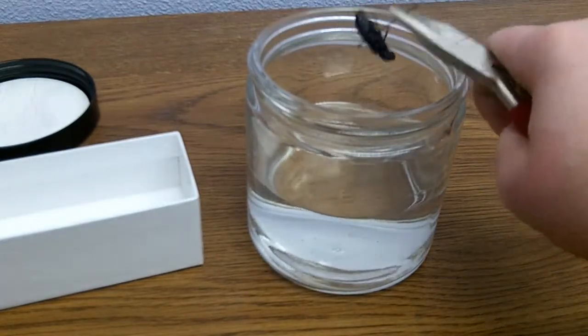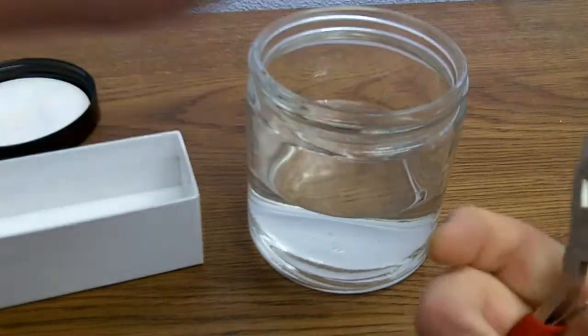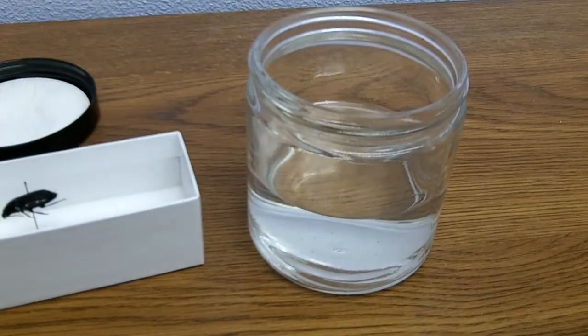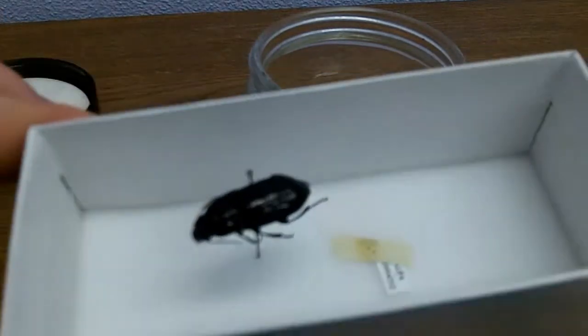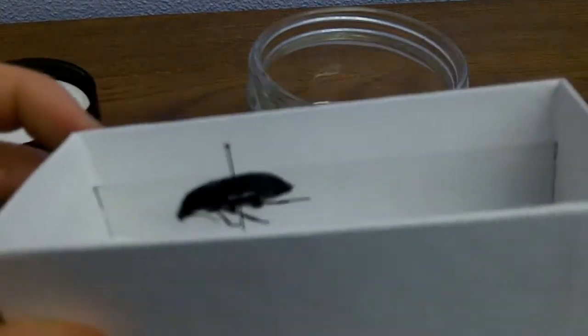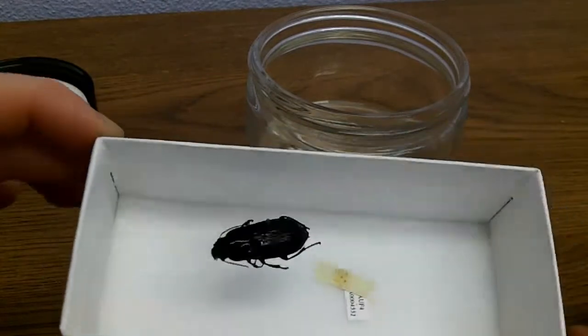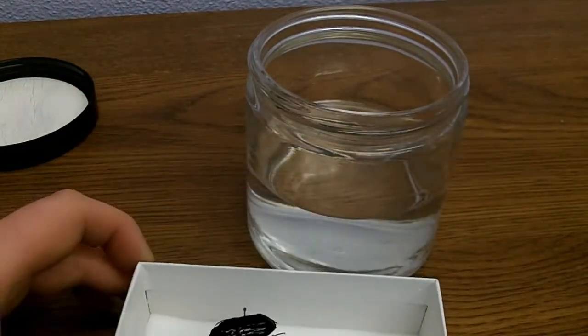Let it dry. You don't want to image it immediately after because it's still wet, covered in ethanol, and that could change how the image will look.